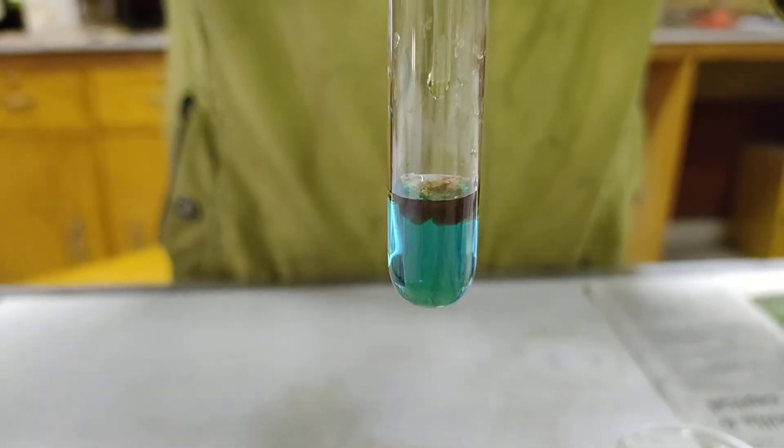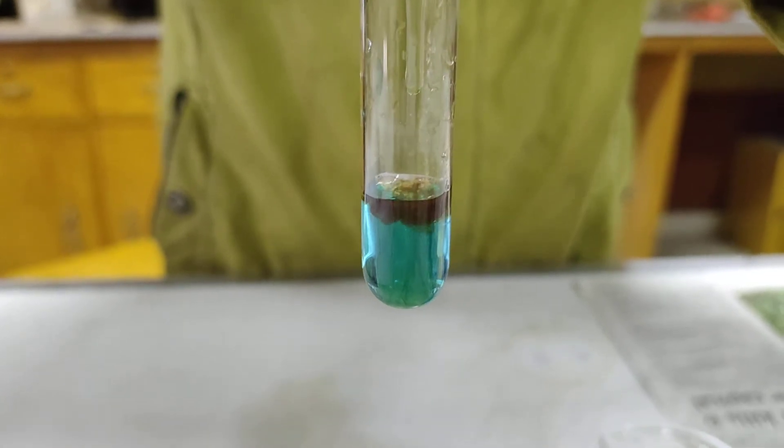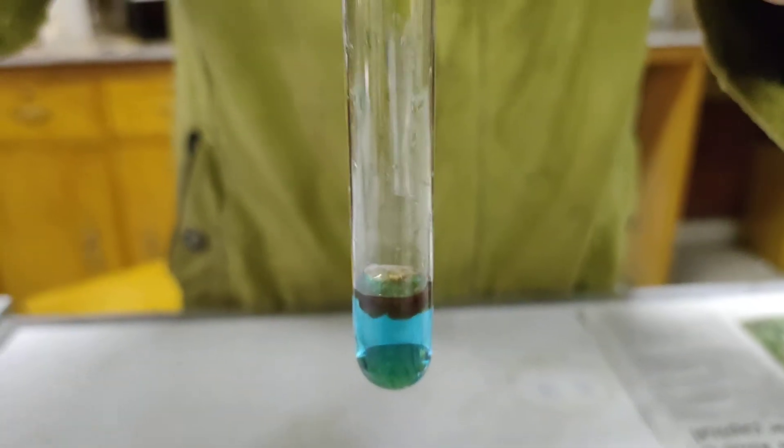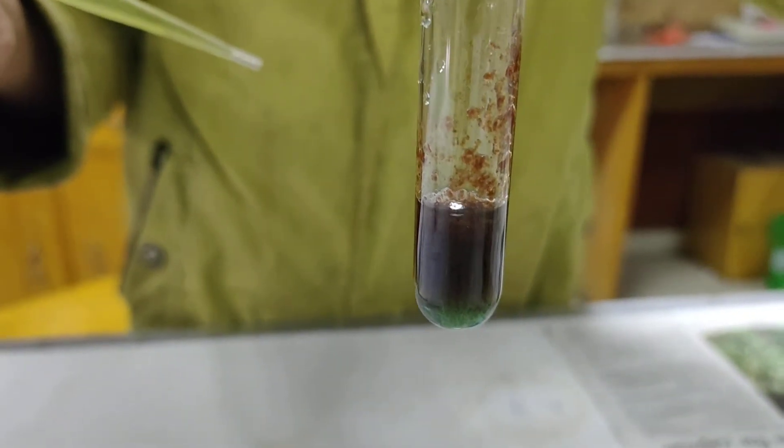This finally confirms the presence of copper in the solution. This is the chocolate brown color — you can see it is chocolate brown. These are all the tests for copper, confirming the presence of copper.